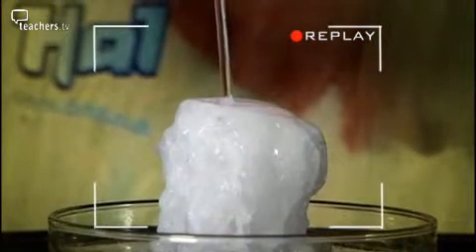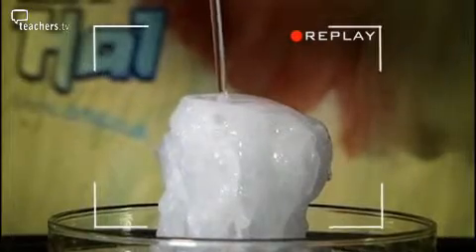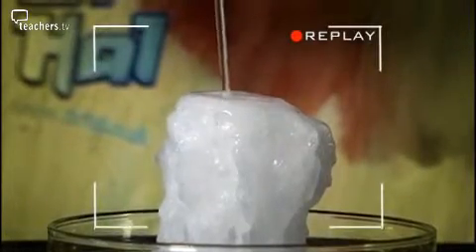You decant the supernatant liquid, and once it's decanted, you allow it to cool. You have to keep a watch glass on top because the slightest speck of dust will cause a nucleation site, and all the solid will precipitate out of the solution.